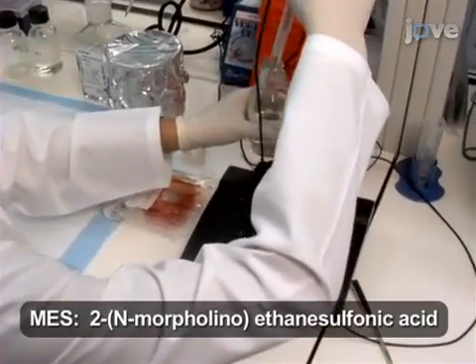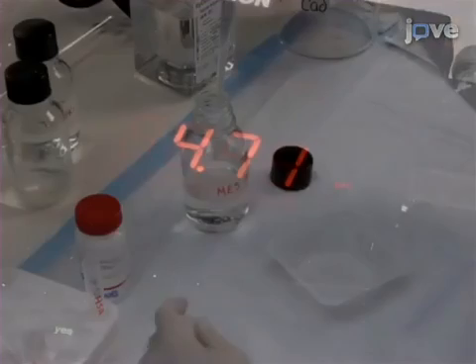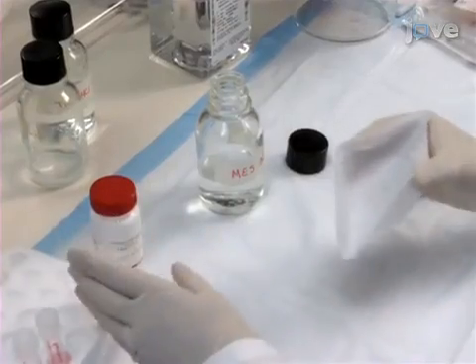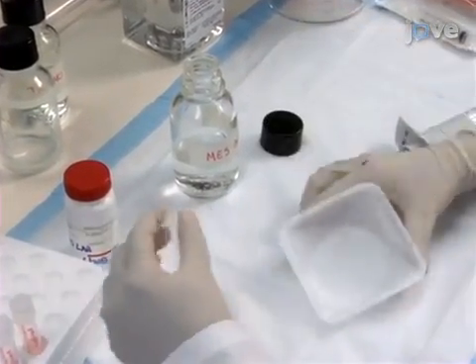To begin, prepare MES buffer as described in the text protocol for both protein-only amyloid and stabilized soluble protein oligomers. Then, weigh the protein of choice and reconstitute it to 10 mg per milliliter in MES buffer. In this demonstration, human serum albumin, or HSA, is used.